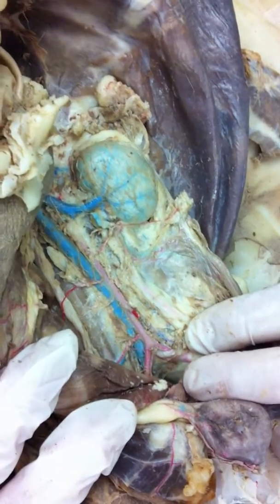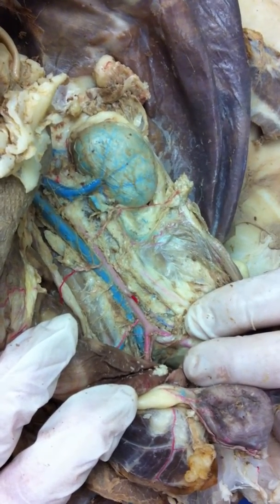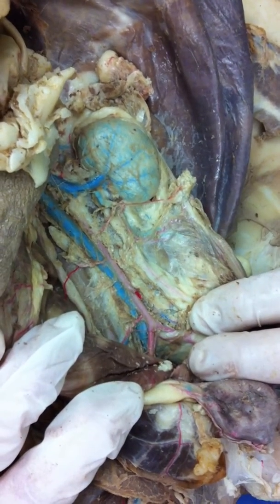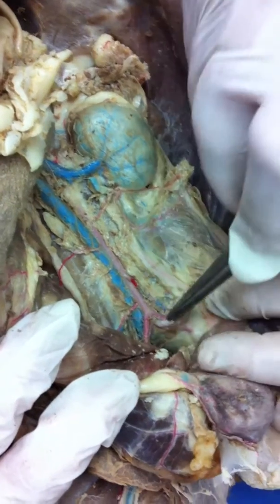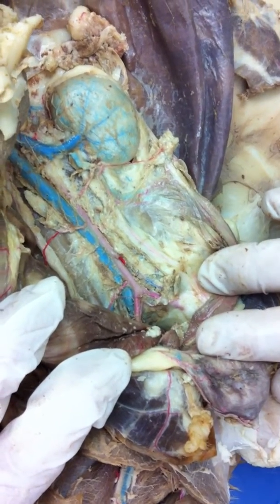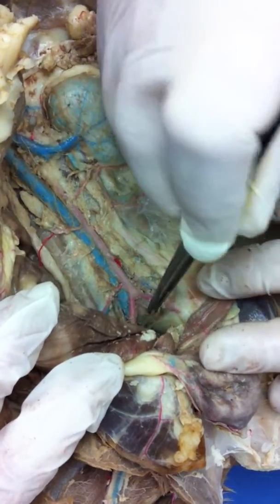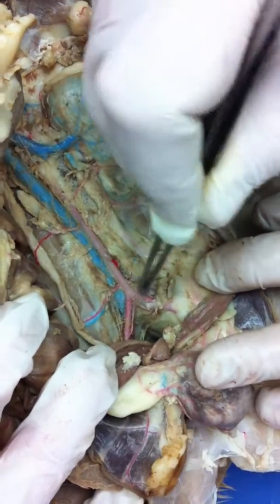Okay, can you see where they've got the external iliac? Right here? Where's their internal? Then they show internals. And they finally show you a caudal or median sacral. Yeah, they give you both labels. External iliac, internal iliac. You can see both of them perfectly.